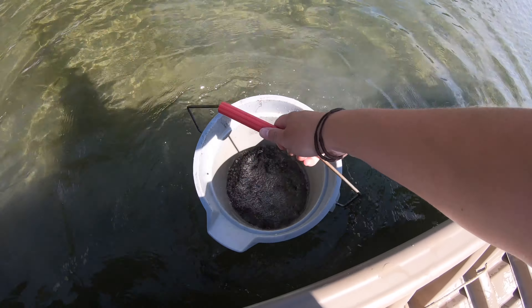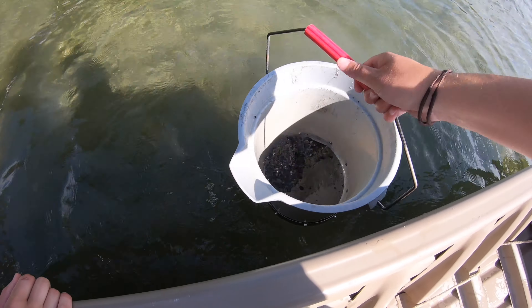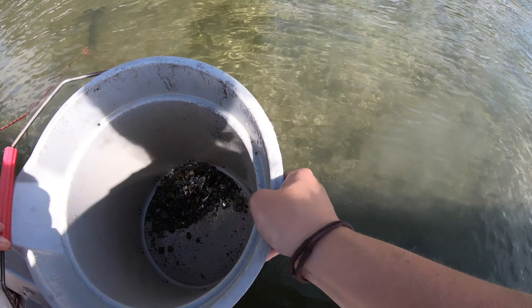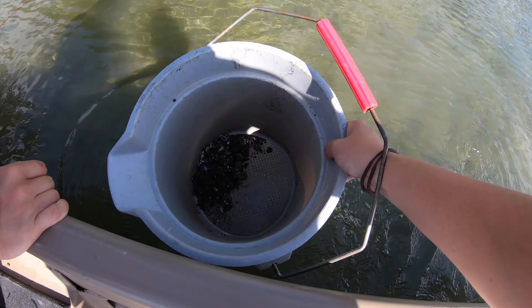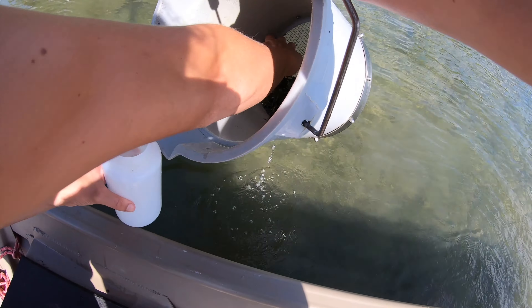That is a good sieve. You grab it by the side and hit it on top of the water like that — you can go all the way down and wash everything out. Looks like we have a ton of zebra mussels in here, maybe some plants. I'm going to slide it on top of the water so it all goes to one side, making it easier for a partner to scoop in.